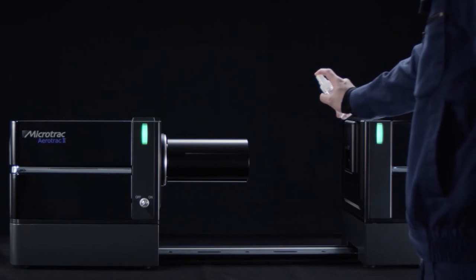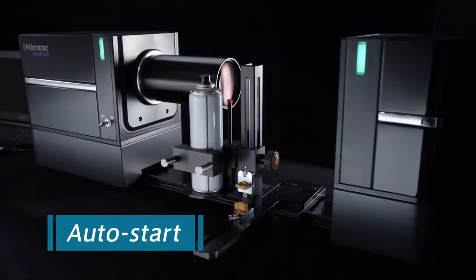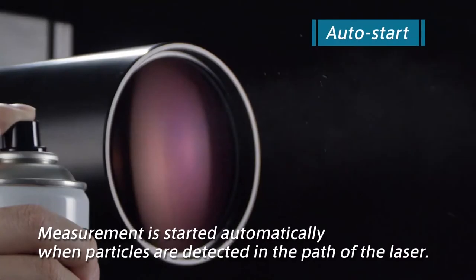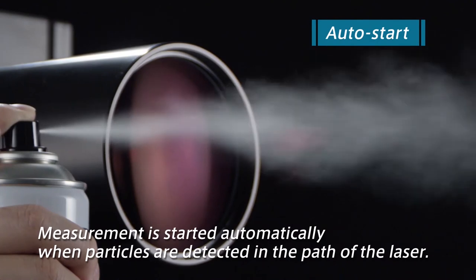Now let's see an actual measurement. Auto-start. Measurement is started automatically when particles are detected in the path of the laser.